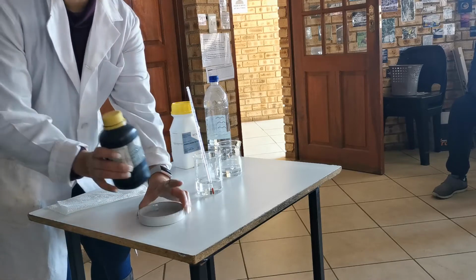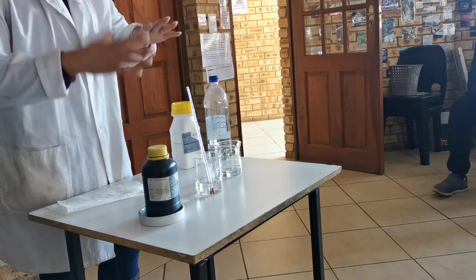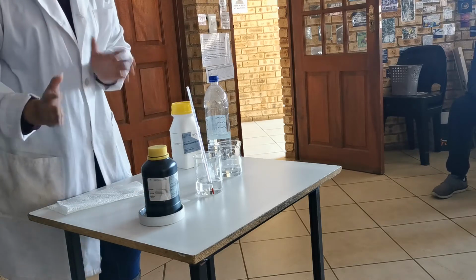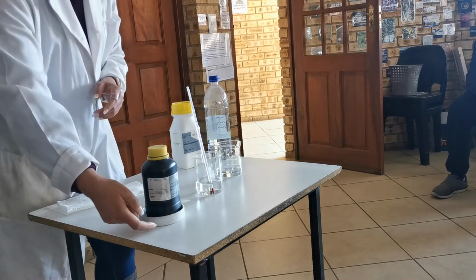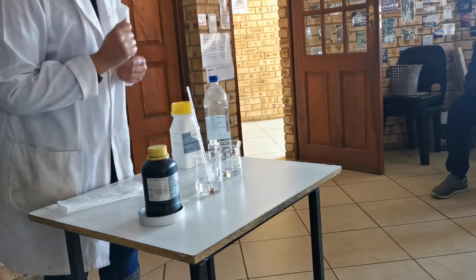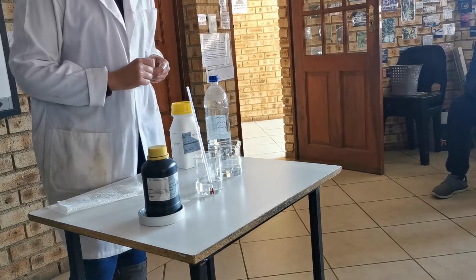It's in this thing called an acid tray, and that is to protect my cupboard inside and to make sure that the acid doesn't leak. Sometimes there's spillage on the side of a container. So we have an acid tray at the bottom, and that's because this is concentrated sulfuric acid. The next rule: we always add acid to water.